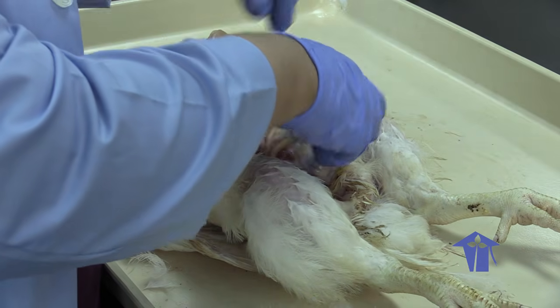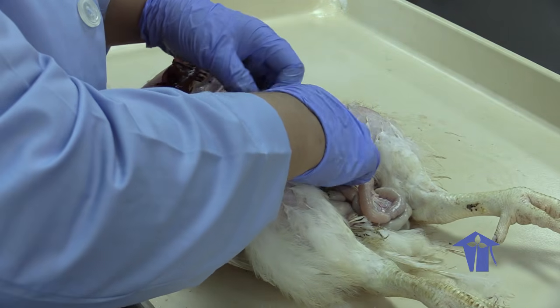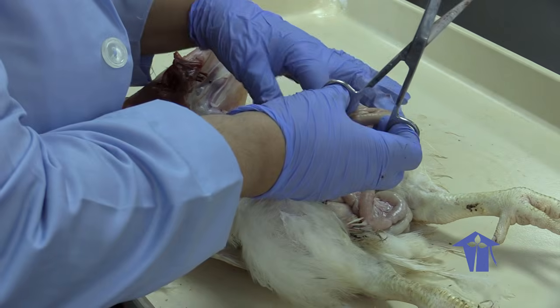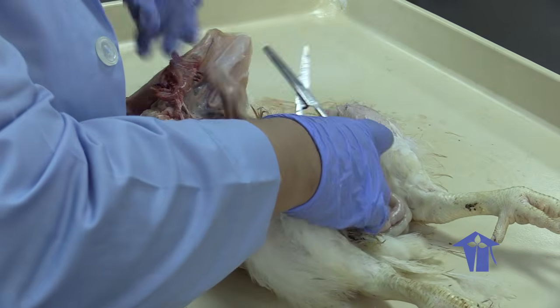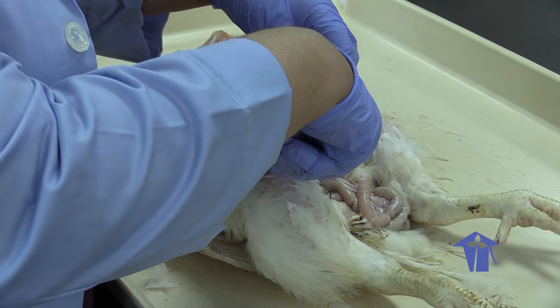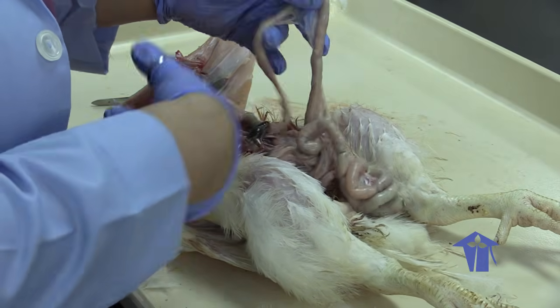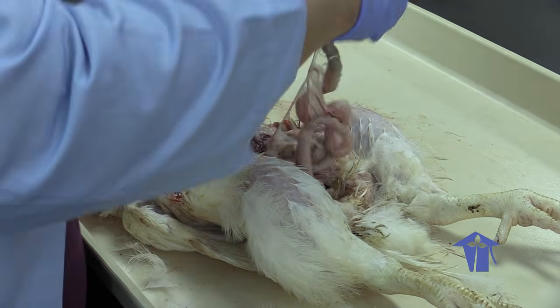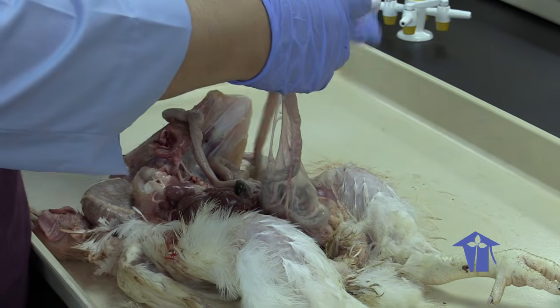So we noted the mesenteries, and now I'm just going to cut them apart to spread this out. I'm leaving this one in the loop to keep the pancreas intact. And then from here, I'm just going to... I am so grossed out. Right. I'm going to cut all of this open. All right. So note that this is some really good packing going on in here.